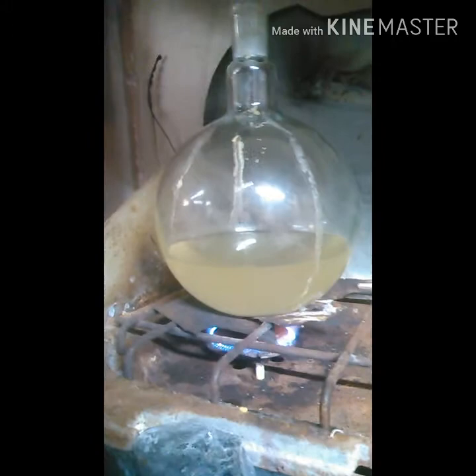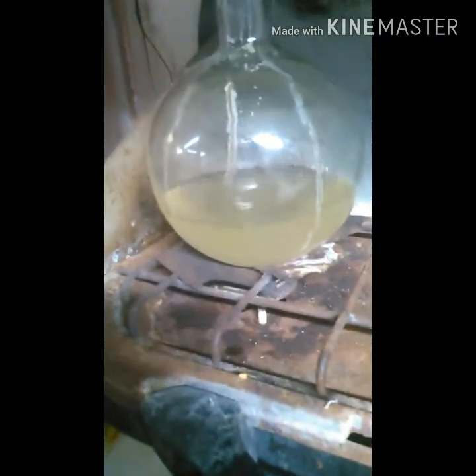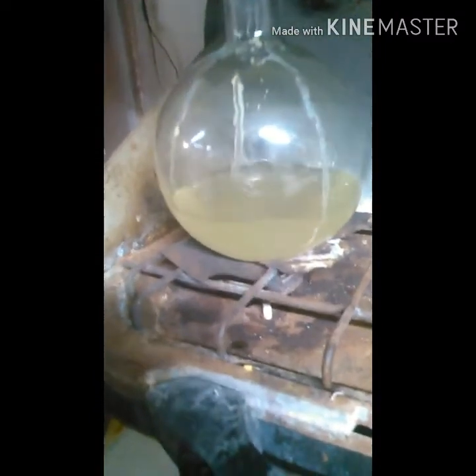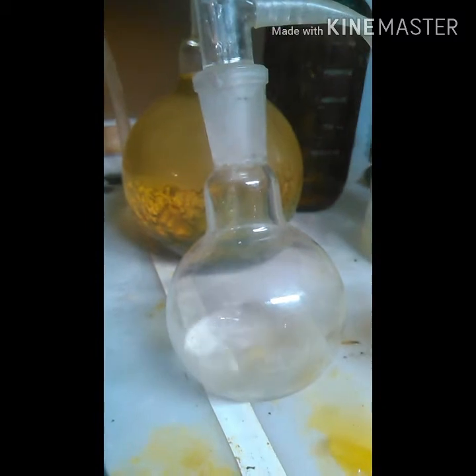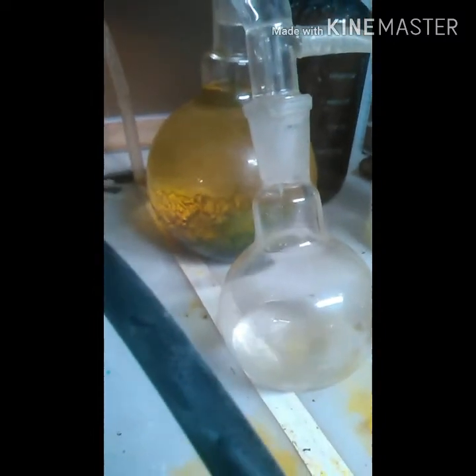It just started bubbling over here. I don't really have a good chemical test for tetrahydrofuran, but acetone and tetrahydrofuran have completely different smells — acetone obviously smells like acetone, and tetrahydrofuran smells like ether. In that little boiling flask you can tell there's no acetone in it just by its smell.